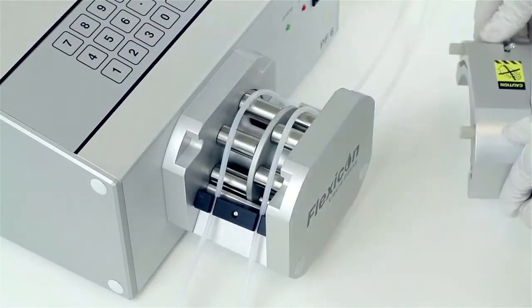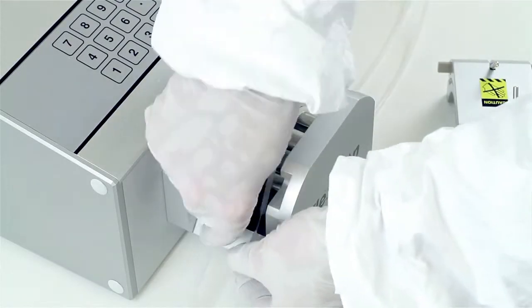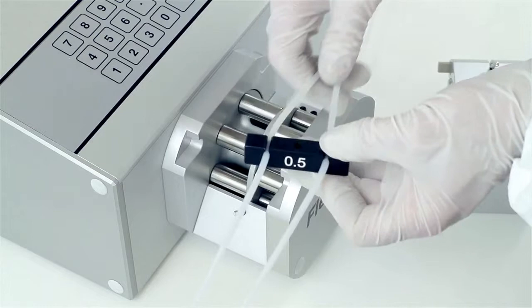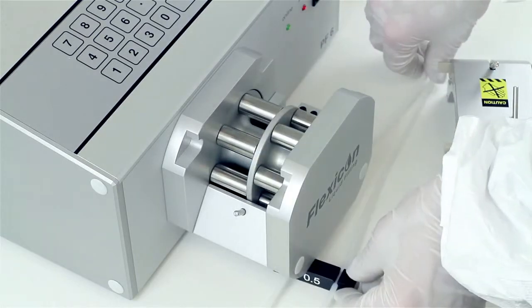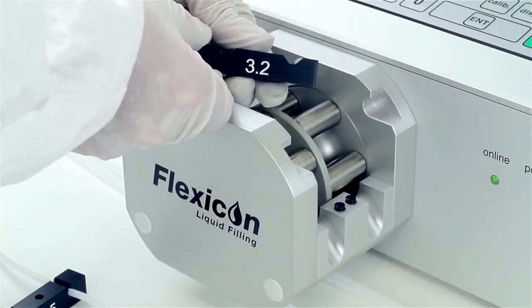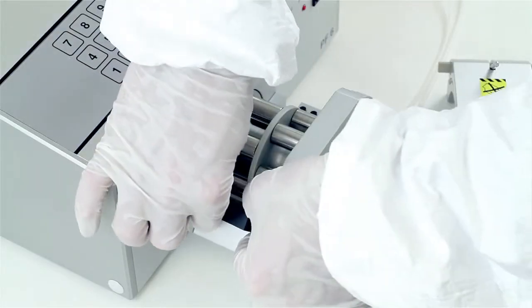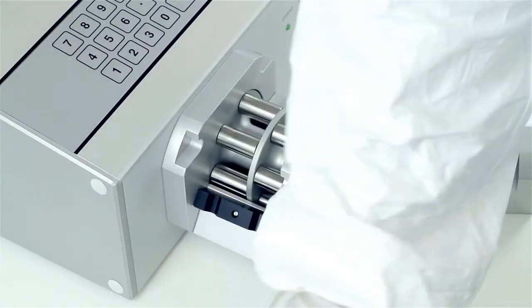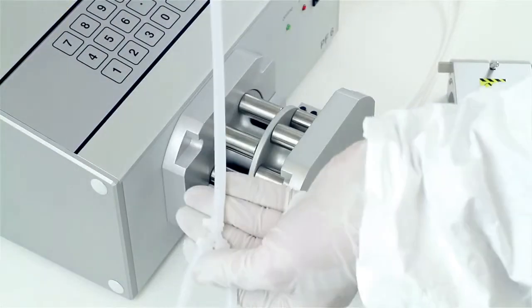When you need to change a fill volume or switch to a different fluid, it is not necessary to change the pump head. It is just a matter of changing the tubing or the single-use fluid path assembly. Changing the fluid path can be achieved in under a minute.